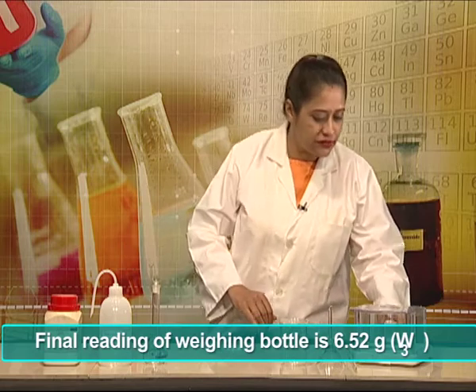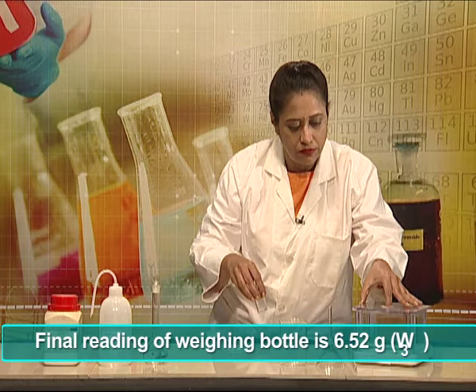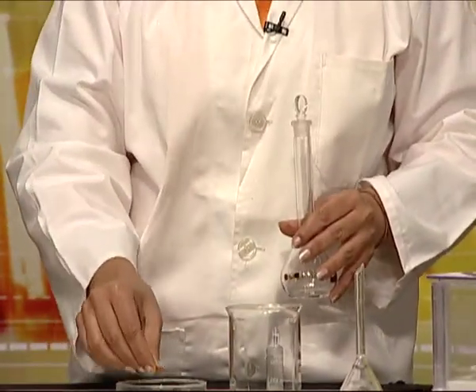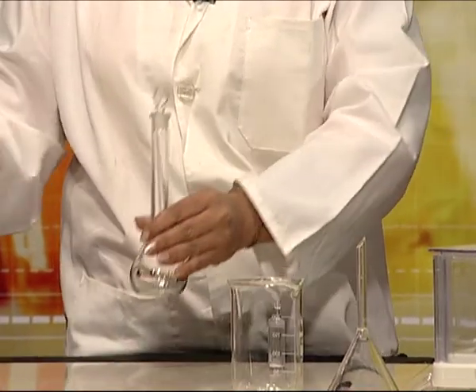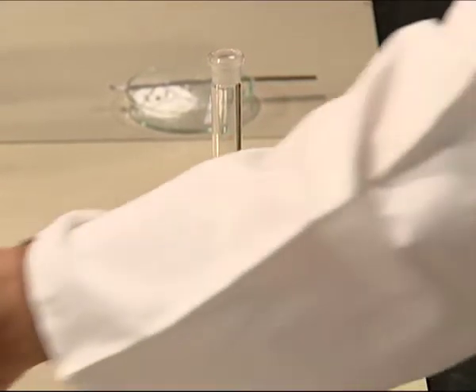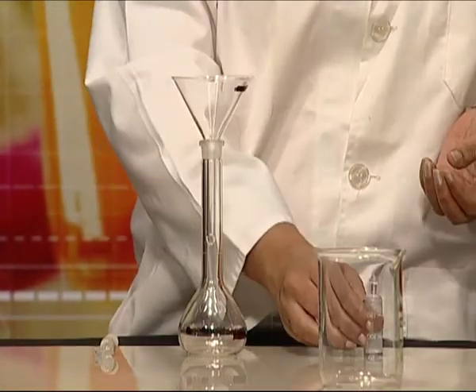Now we shall carefully transfer the salt into the volumetric flask.